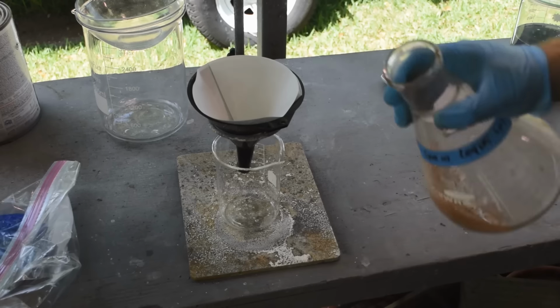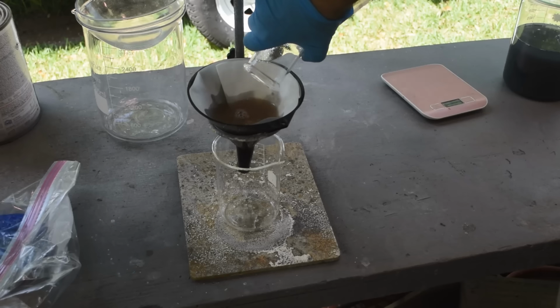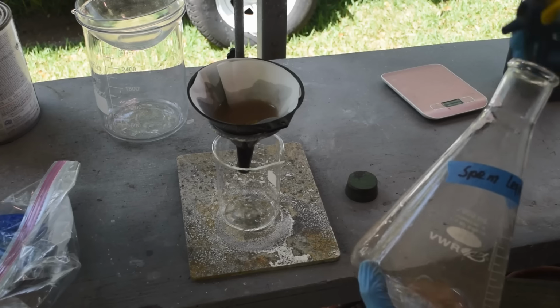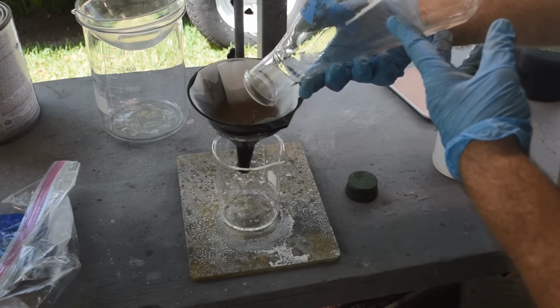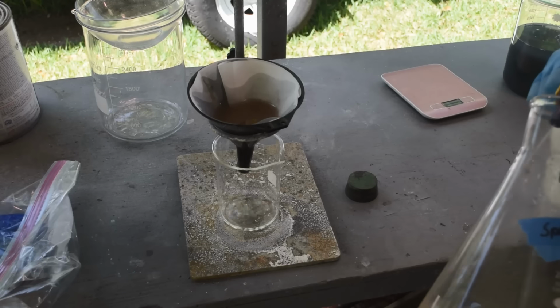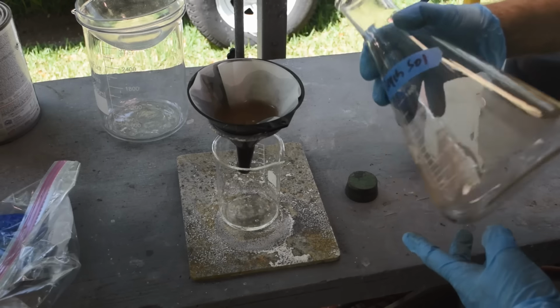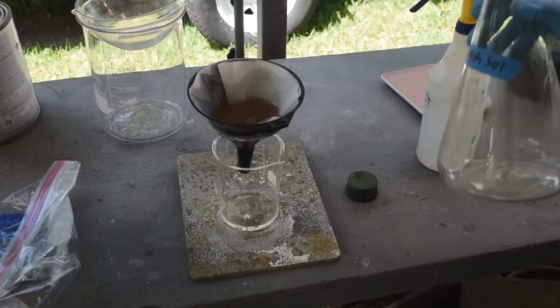So what I want to do is capture this stuff on a filter. We'll put this filter in some aqua regia, and we'll give it a test with stannous chloride and see just what we're dealing with here. It's got a scum of it on the inside of my bottle here. It's not coming off. If it's gold, we'll know that some of it's just staying in solution. If it's not gold, and it's just some sort of heavy metal hydroxide, well, at least we'll know that.